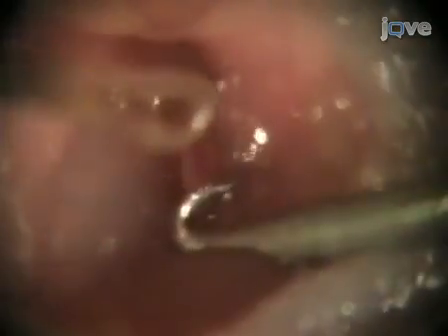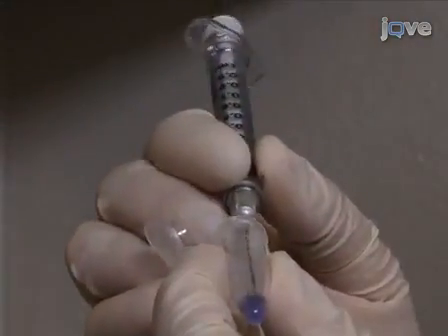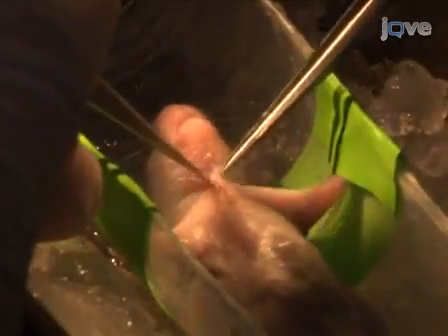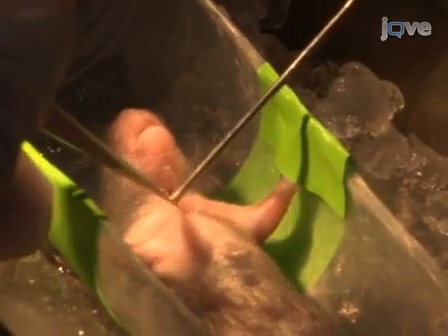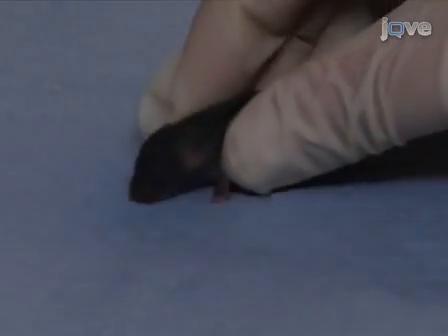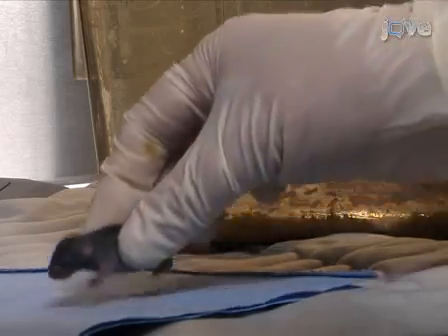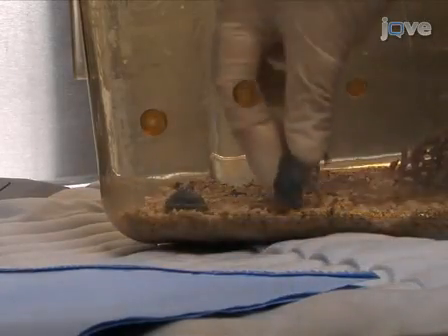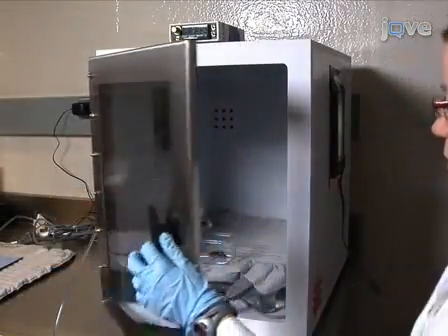Then use a hook to isolate the common carotid artery from the nearby vagus nerve and sympathetic ganglia. Now cauterize the common carotid artery. Following cauterization, close the skin incision with tissue glue. Use a heating pad to keep the animal warm until it is fully awake, and then return it to the dam.